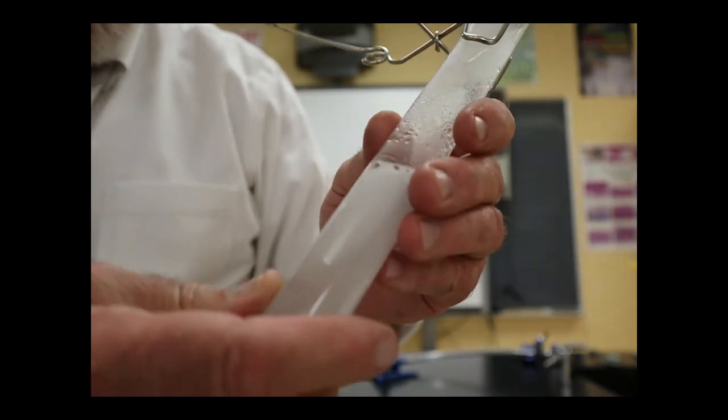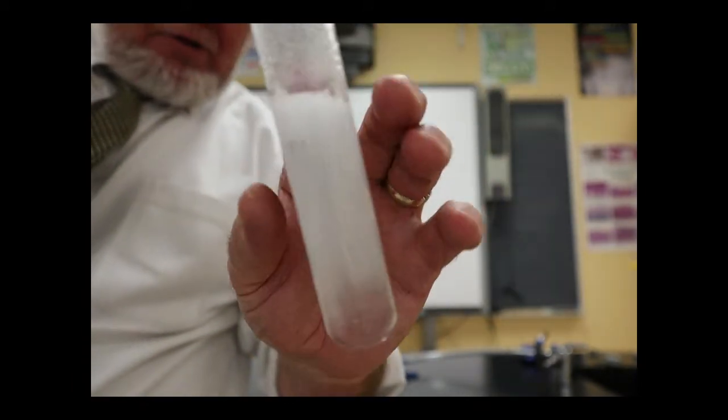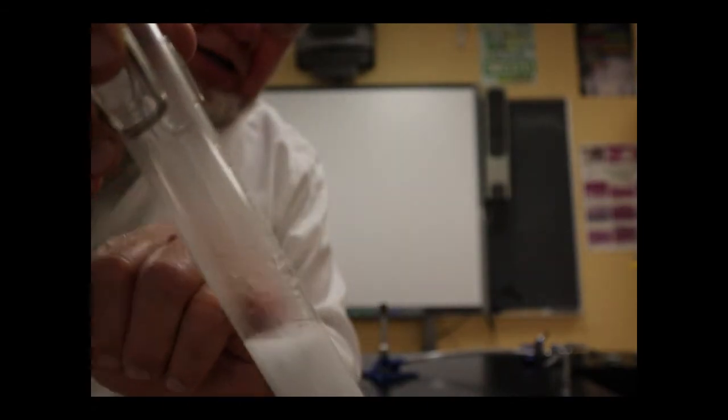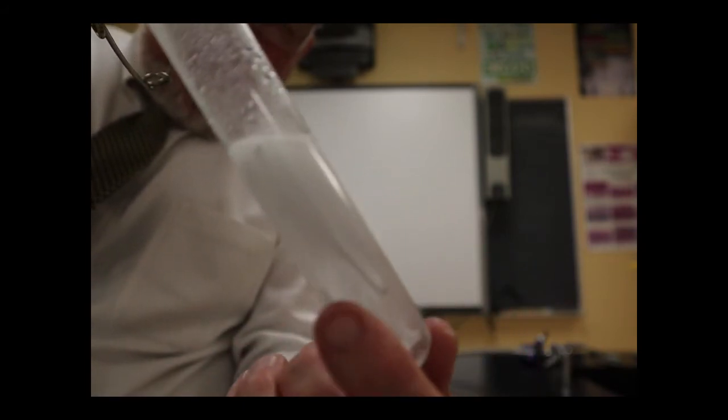So this is what we call an exothermic reaction. You can kind of see that there's condensation up along the sides of the test tube here. All right, it's bubbling. Still can see that piece of magnesium right there. All right. And let's kind of shake it up a little bit.